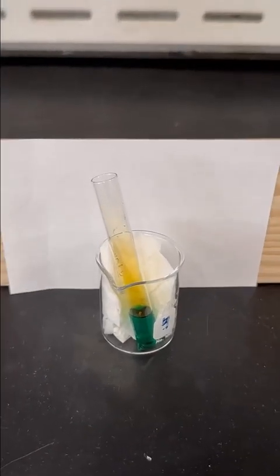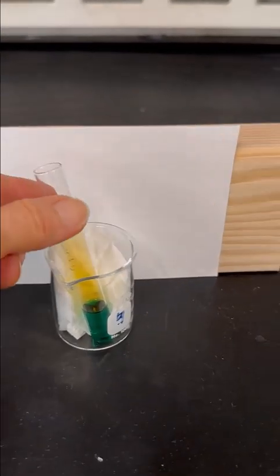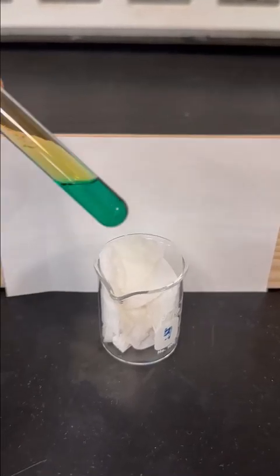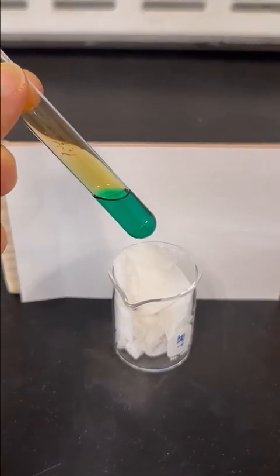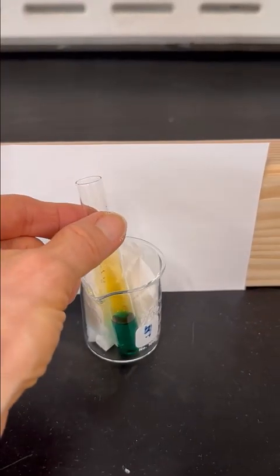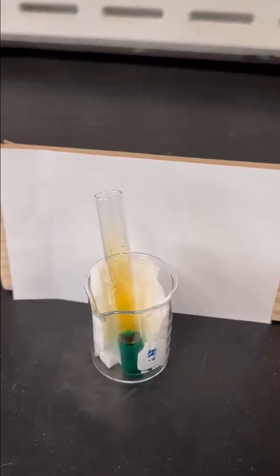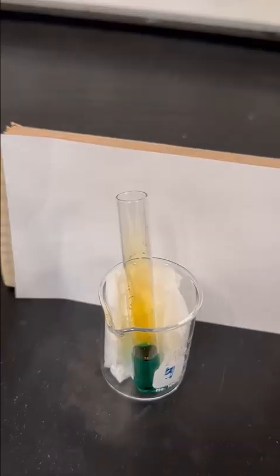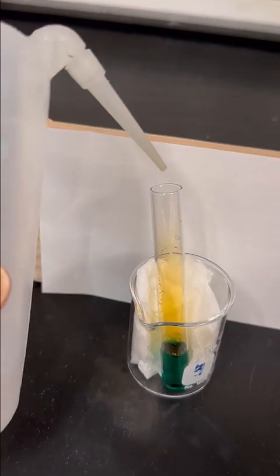All right, so our copper nitrate has been sitting here now for a while. You can see it's still reacting a little bit. Still have a little bit of that brown color coming off. I'm going to add a couple of mils of water just to dilute this a little bit and get the reaction going a little bit more. All right, so I'm going to add just a little water.